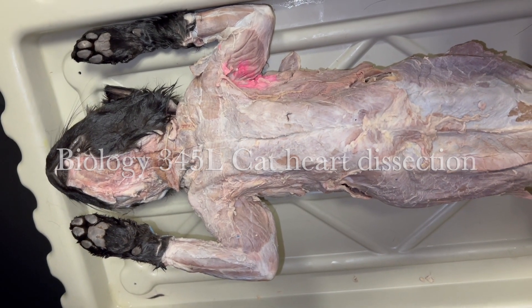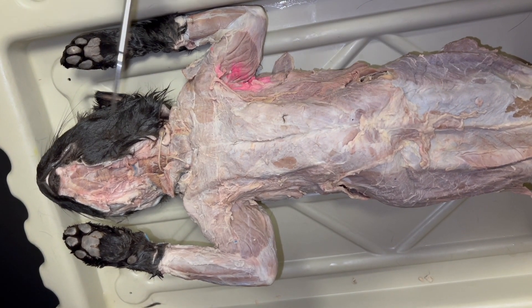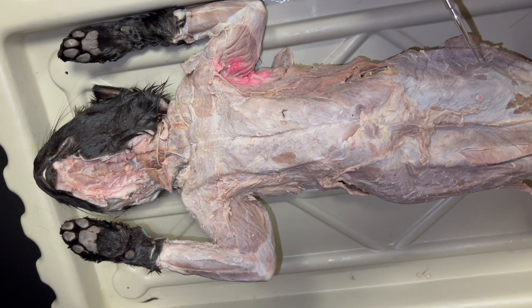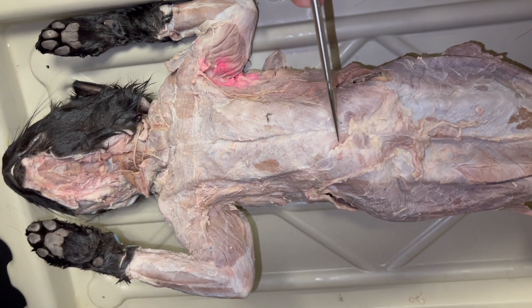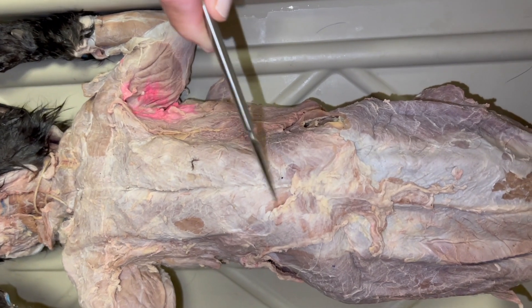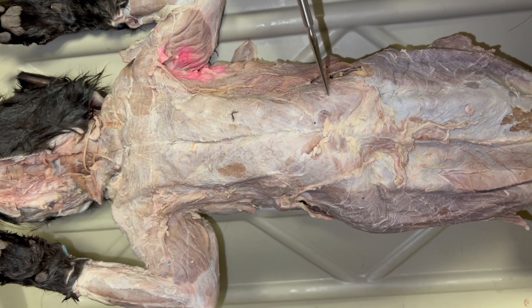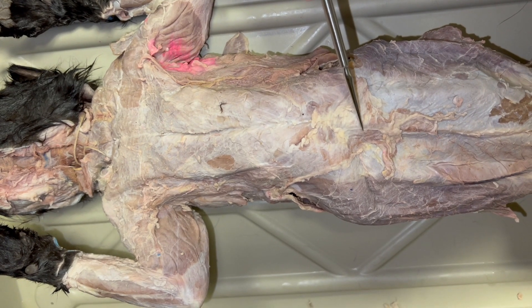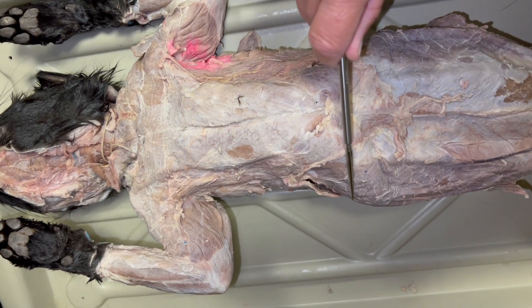Hello — we're going to look at your cat's heart. You'll have the cat on its back like this. If you remember the xiphihumeralis, this muscle here, and you know how they're coming in and they come to a point about here — use that as a marker.